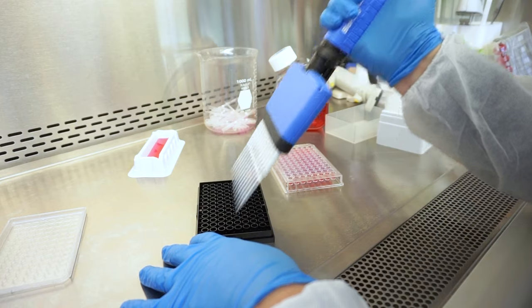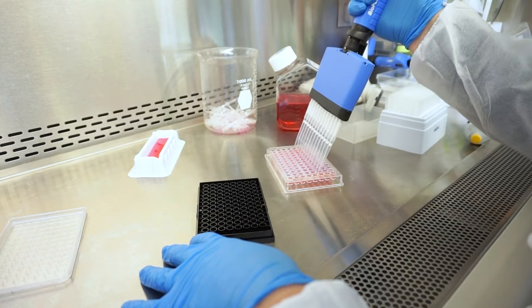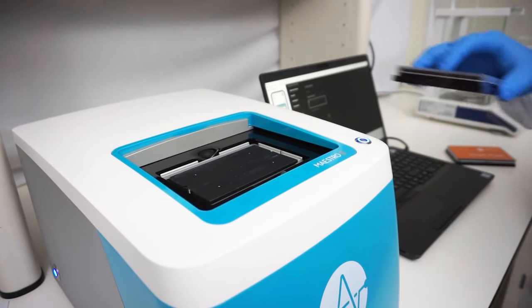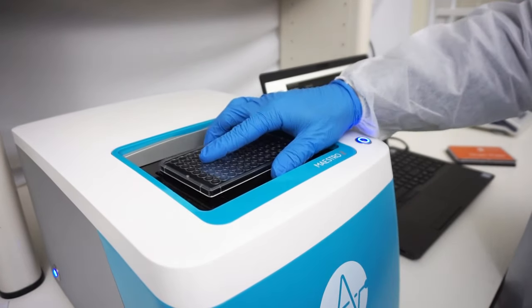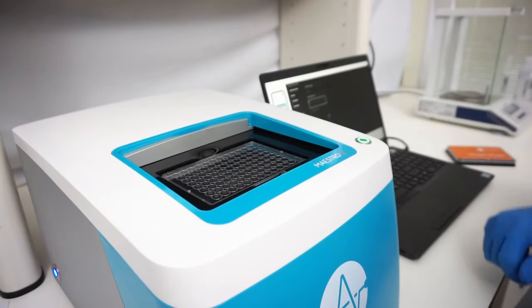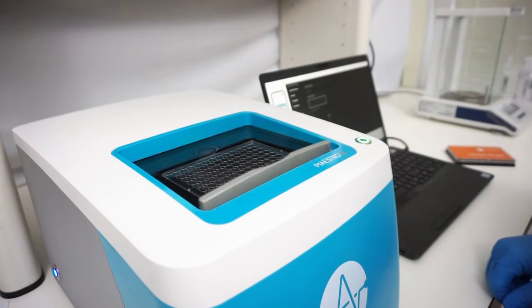Add the chemotherapy compounds to the plate. After dosing, put the plate in the Maestro Z system and push the button to resume the automatic data collection.